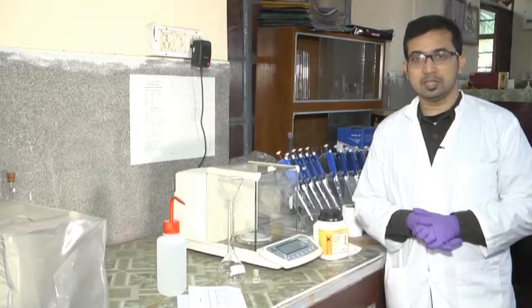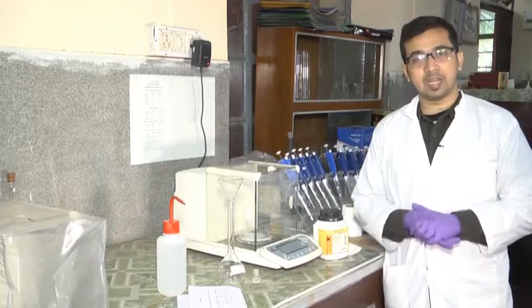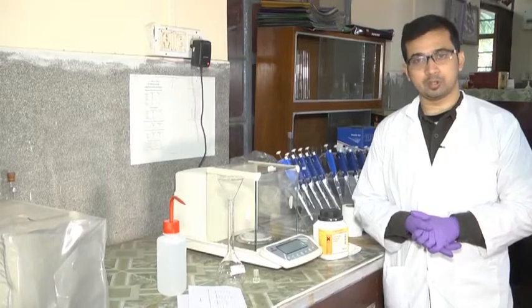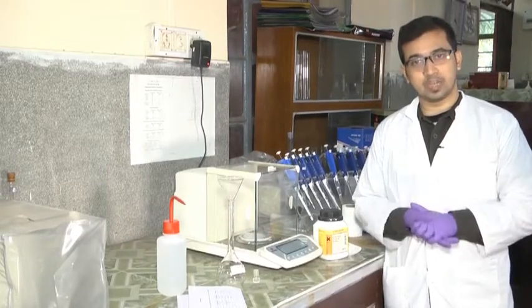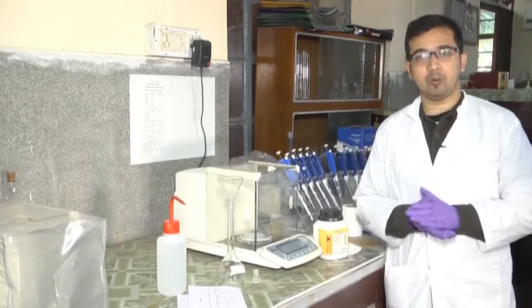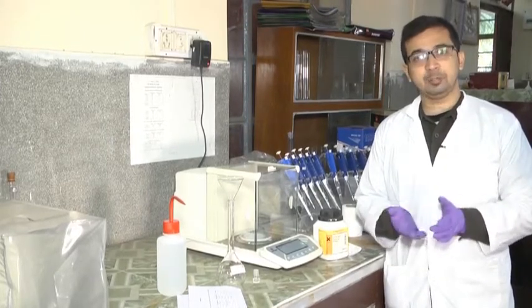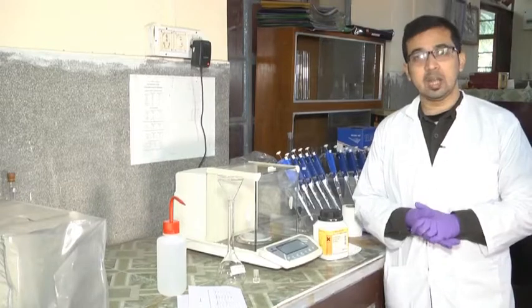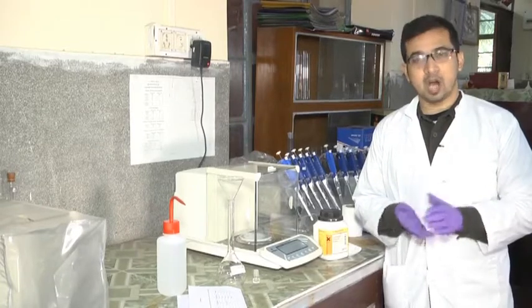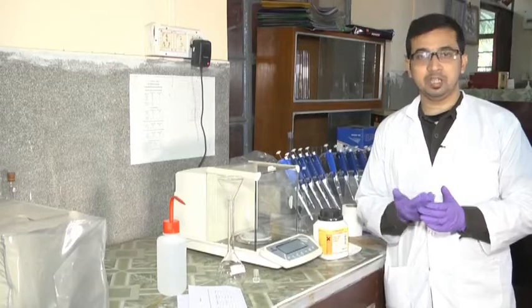Initially we have to prepare the primary standard, which is oxalic acid, then NaOH. We have to standardize the NaOH — which is a secondary standard — using the primary standard oxalic acid. After we standardize the NaOH, we will standardize the HCl. NaOH will be added dropwise to the acidic or basic amino acid, as we have seen earlier in the case of glycine. The amino acid initially needs to be protonated using HCl, which will be standardized using NaOH.